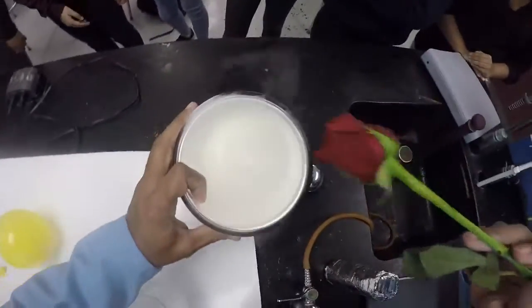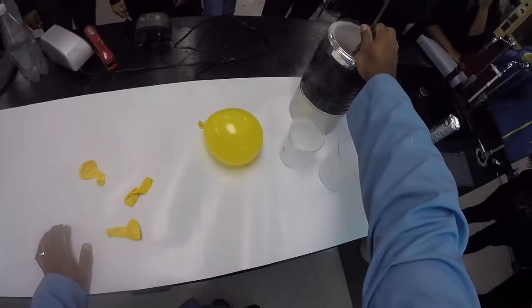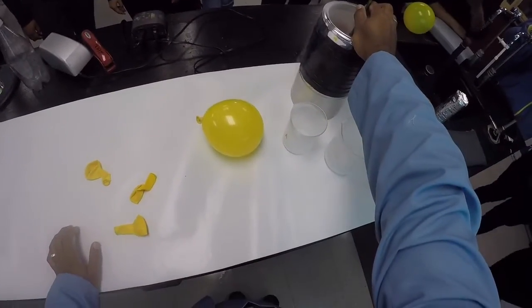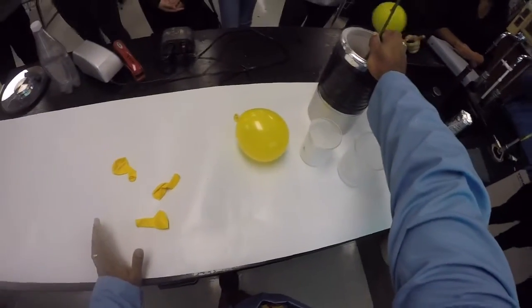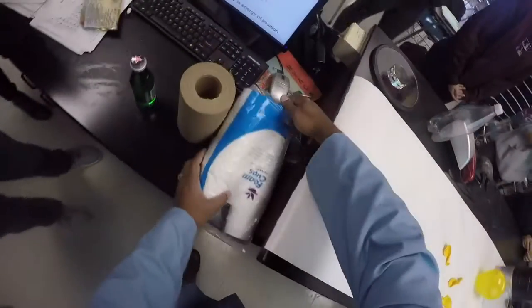One of the other things that we like to do, and somebody already saw this, I should have swept it up. We just like to put stuff in liquid nitrogen, so I put a little rose inside there. Anytime you put something in liquid nitrogen, it usually makes it pretty brittle. That's because the bonds between solid molecules usually have some sort of elasticity, meaning they're not so rigid. But when you cool it down, the energy decreases and the bonds become more rigid, to the point where it becomes really brittle. I want to let that sit in there for a while. I actually had something else planned.